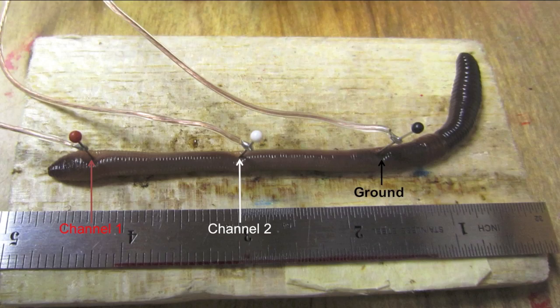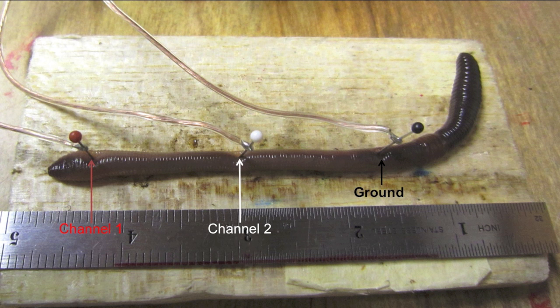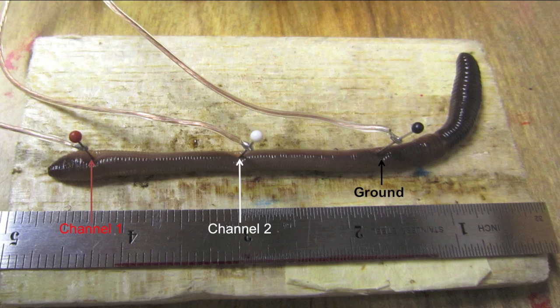The sewing needle electrodes are placed directly into the earthworm, slightly off the center line. Don't worry, the earthworm can recover quite well from this experiment, and he will be returned to his soil after we are done.